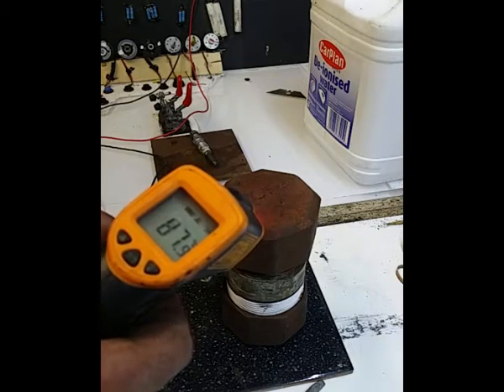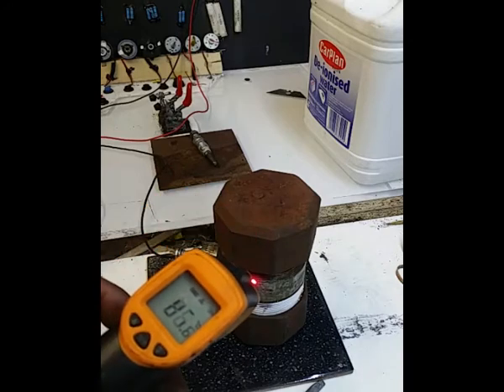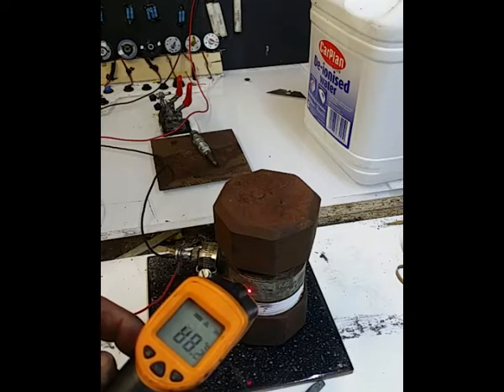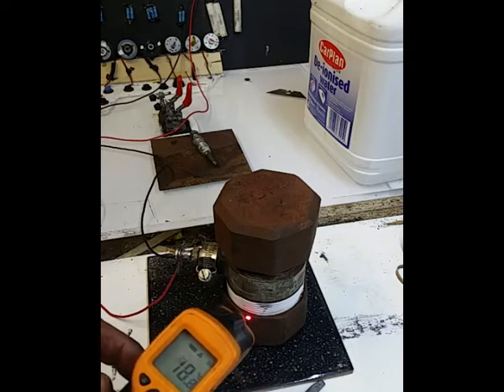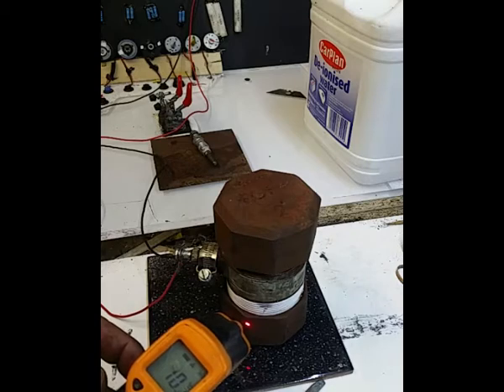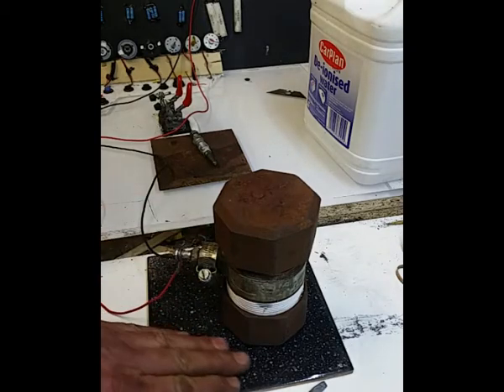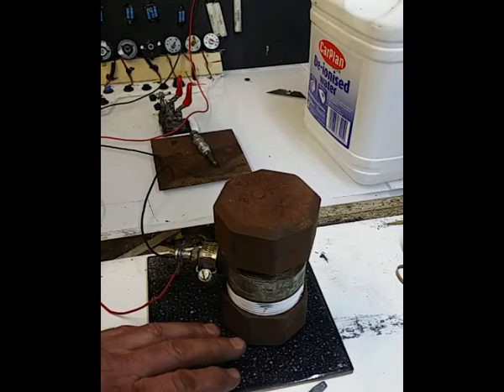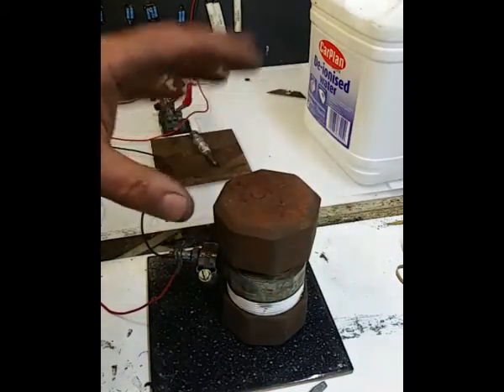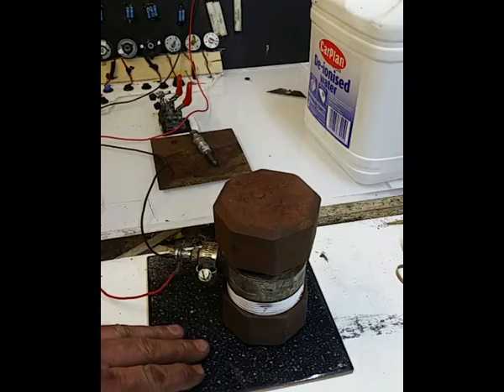Now that's at 87 now, 87.8. Have a look at the body, that's 88, and the base, now the base is, according to that, 70 degrees. Now you would expect that, because I'm assuming we've got some thermal loss into this tile, and obviously heat rises anyway, so the top's going to be hotter than the bottom. But at the end of the day, it should all kind of even out in a bit.